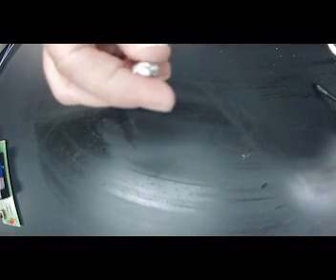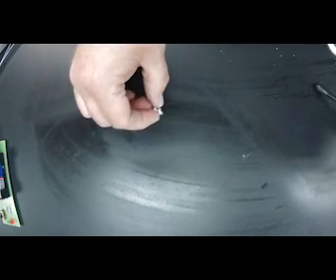So the first thing we're going to do is the tapping. So what does the tapping tell us? Notice this is not in a wire and it's not really flat. But can you do that to aluminum? Can we make it flat? So think about that. Those are physical properties of aluminum as well. What are your soda cans made of?